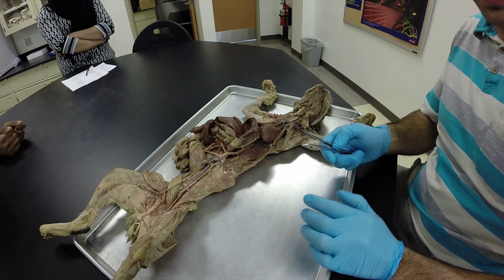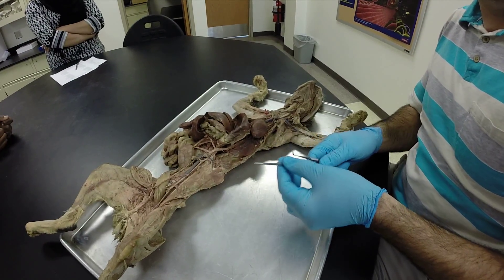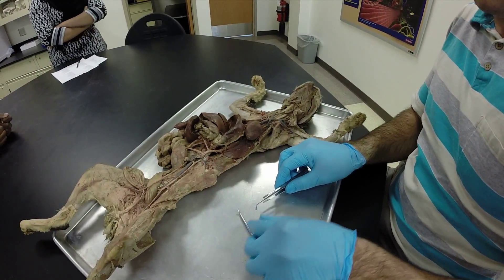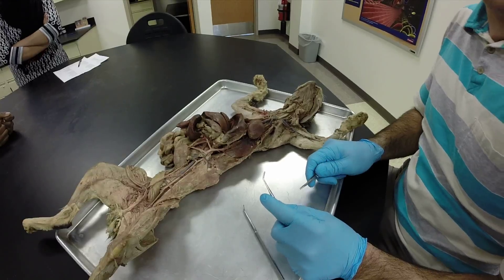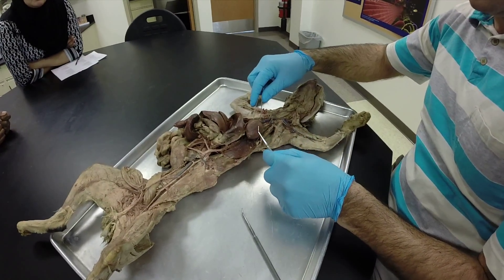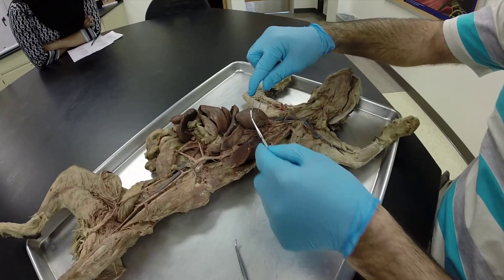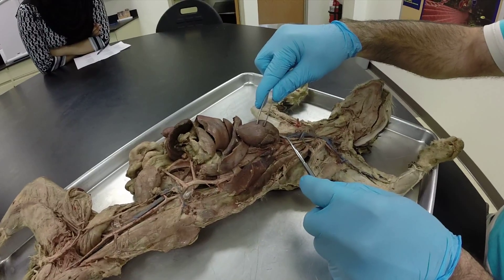In this video I want to go over the arteries and veins on the cat that you're responsible for. If we start out here at the heart, we can see this main vessel coming off the heart.